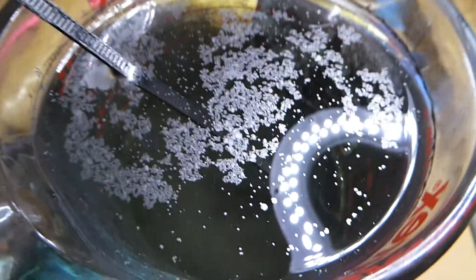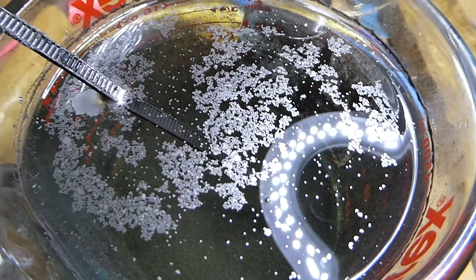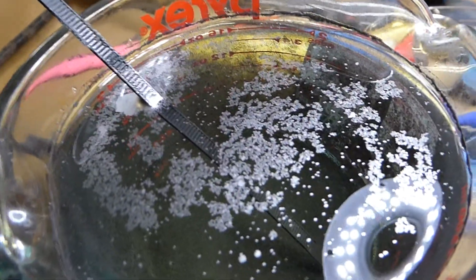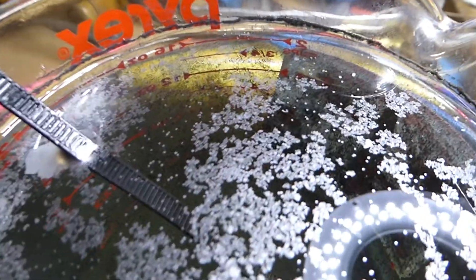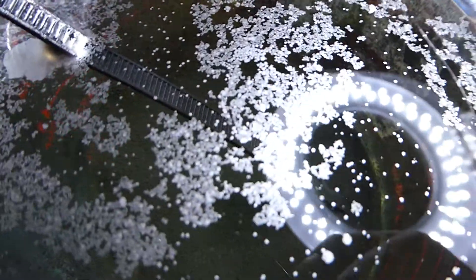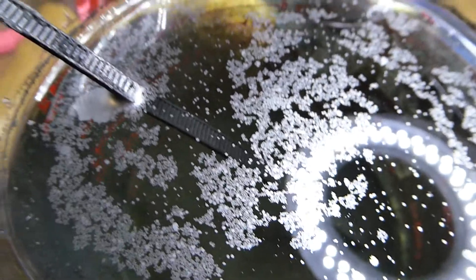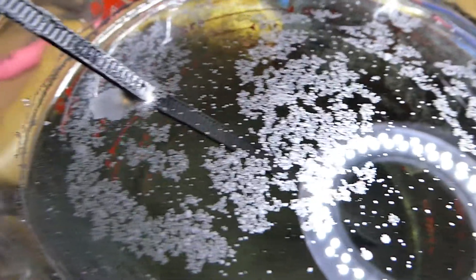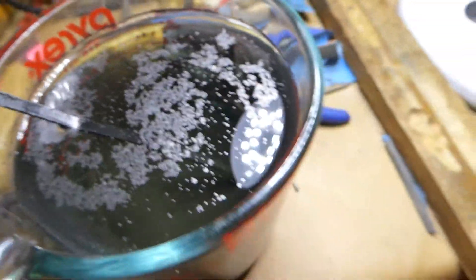I've mopped the top of this several times now. And I've been told that the appearance of those flakes are moving up and just sitting there, that they are single layer graphene plates. And that they don't want to sink back in.